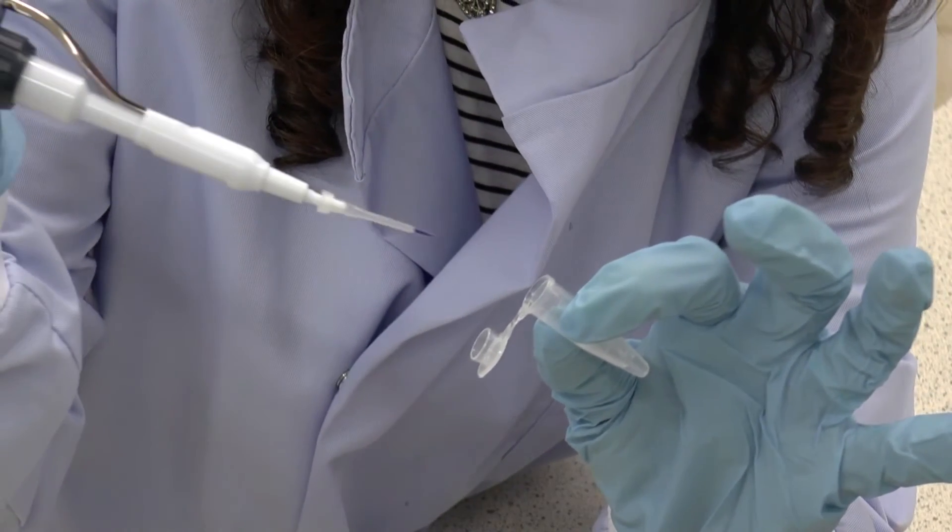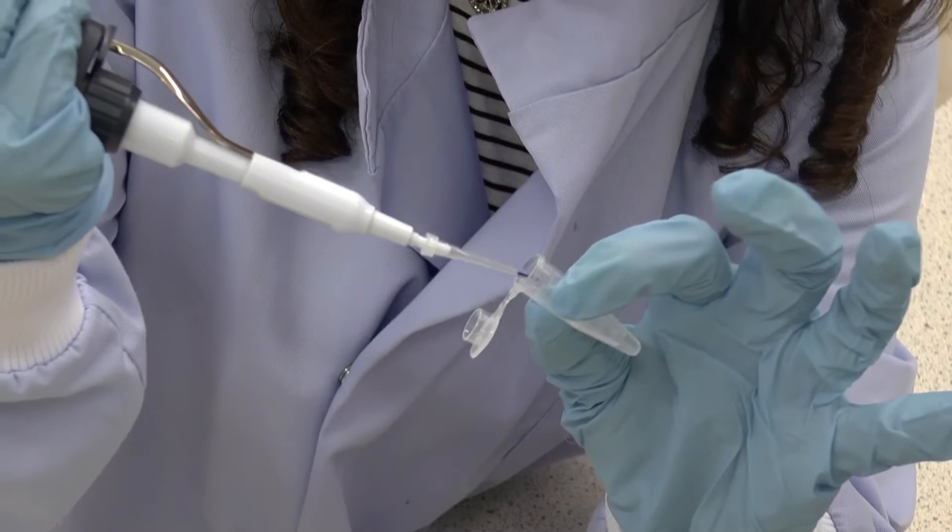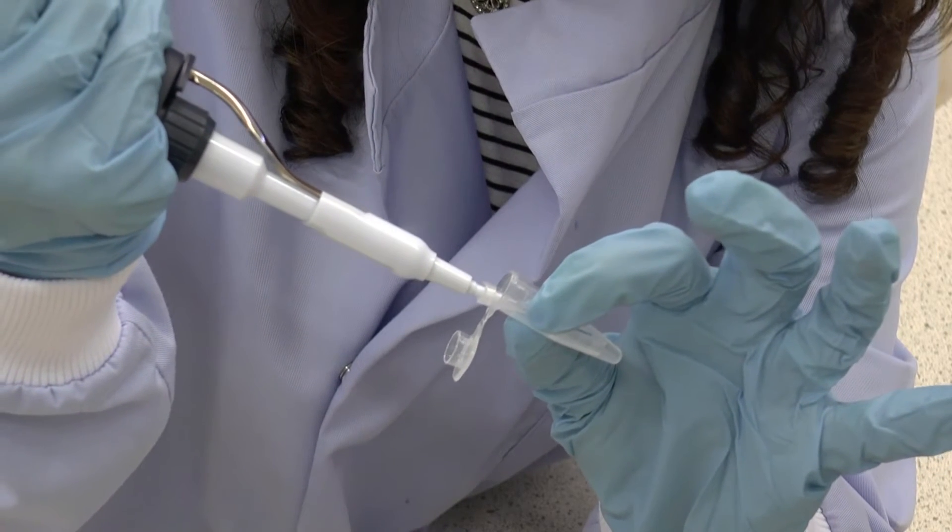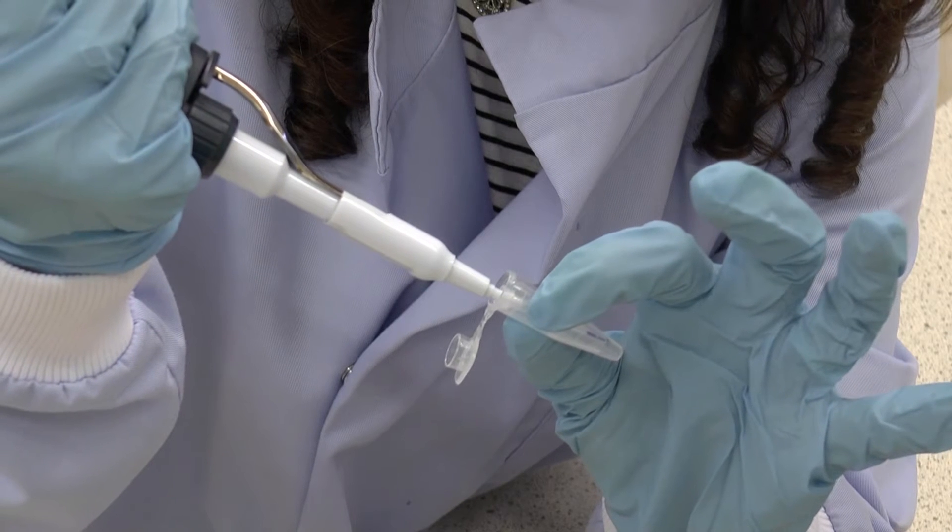So I've got 50 microlitres of water and I'm going to add 2 microlitres of loading buffer, which you can imagine acts in a similar way to an enzyme.